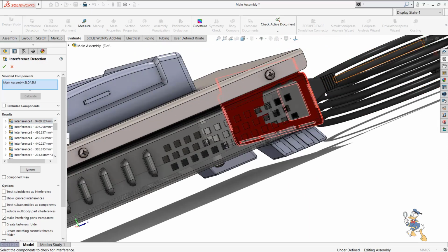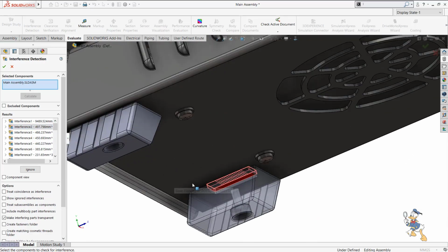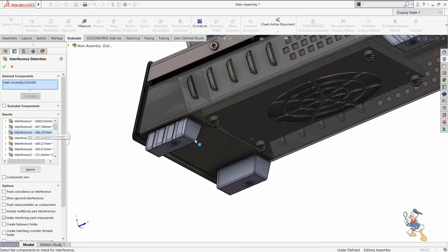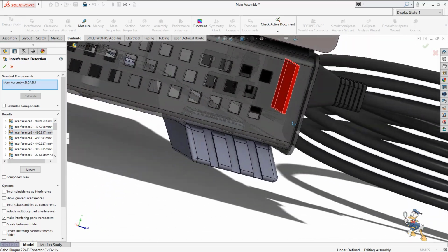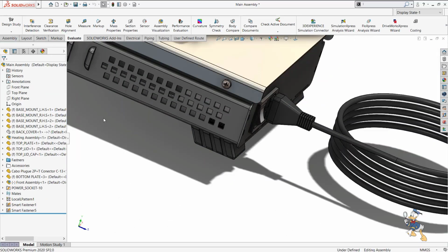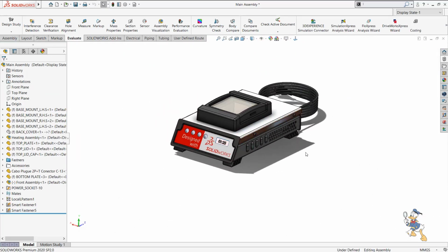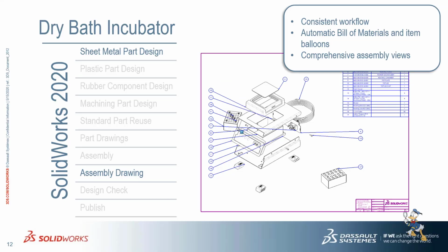Calculation, yeah, we have interference over here, we have interference over here as well with our rubber base mount. So we can see these kind of interference in our design, and it is not a much time taking process. I just need to check whether interference is there or not, and whether it is applicable for our design or not. We just see and we can move further.